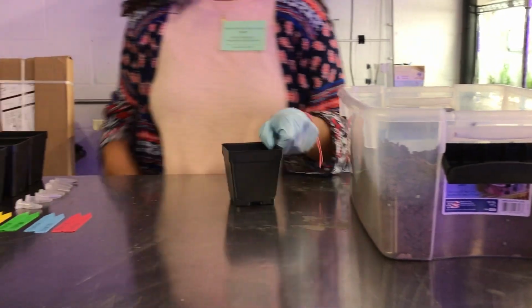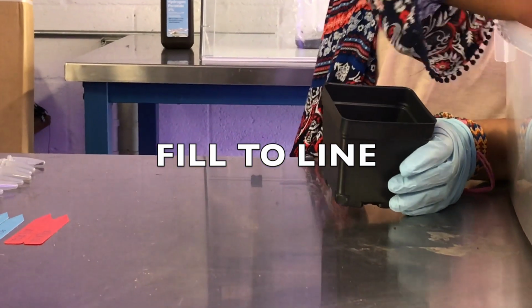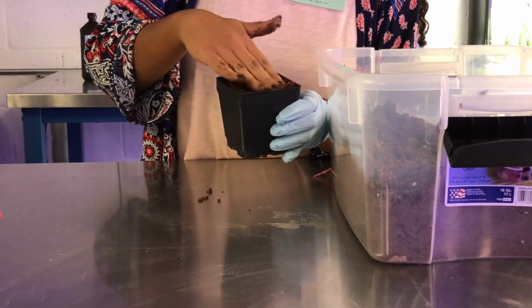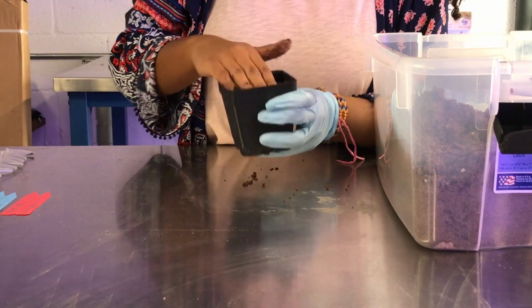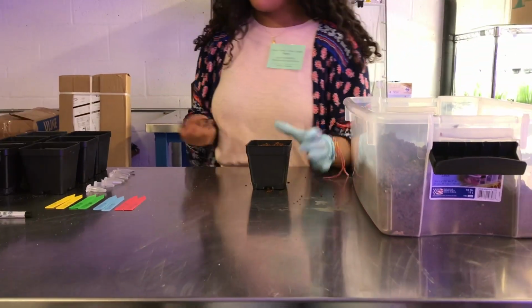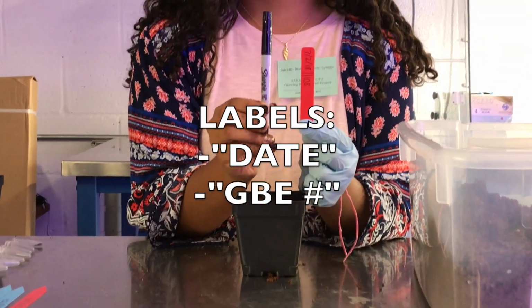When adding the medium to the pots, make sure you fill it up to the line. Tap the medium down, but do not compress the soil. Make sure your labels have the date and the GBE number found on the lid of the Eppendorf tubes.